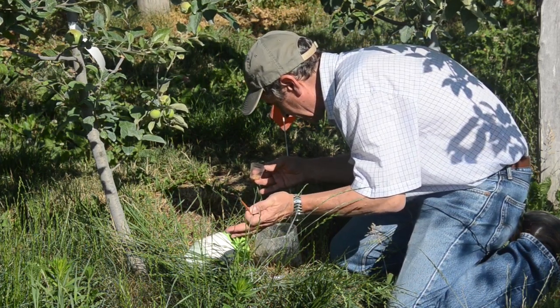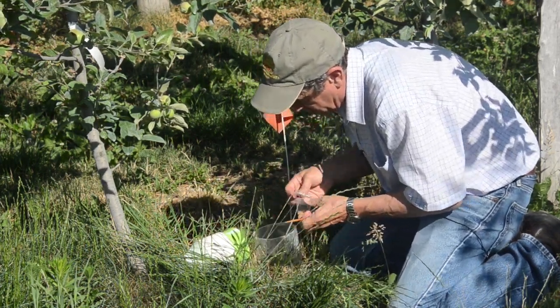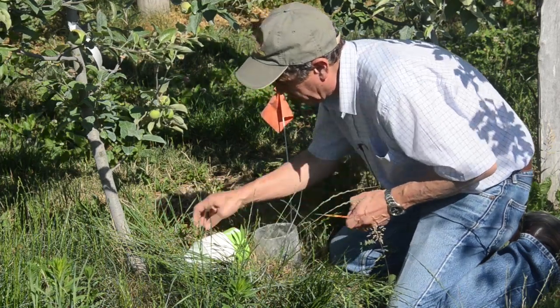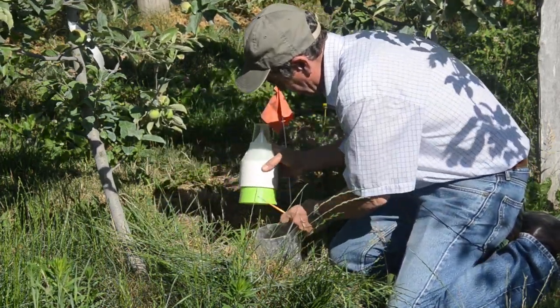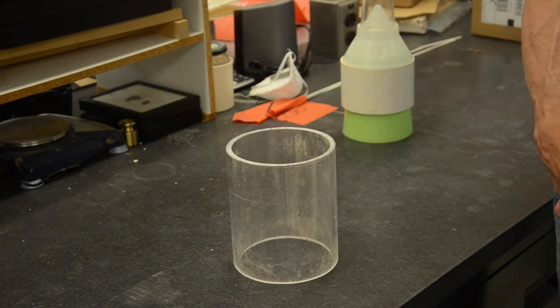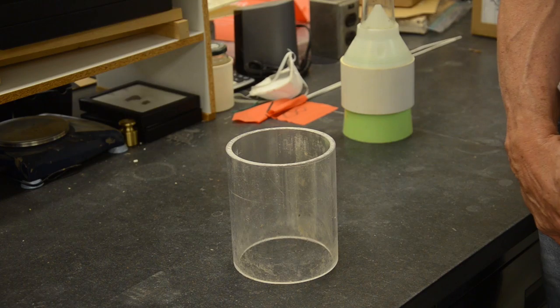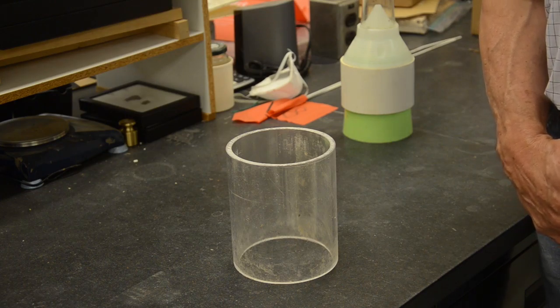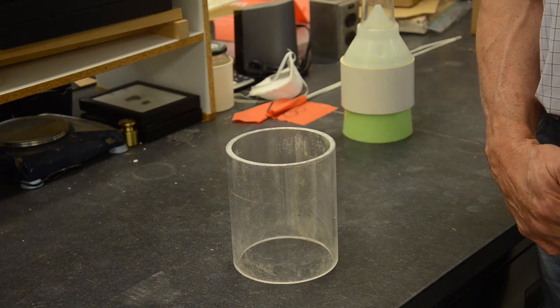We allow them to burrow into the soil to complete their development. The idea is if there's nematodes present, most of them should be attacked, or maybe some of them should be attacked and wouldn't make it to the adult stage. But the ones that do survive and manage to make it to the adult climb out and crawl up the sides.